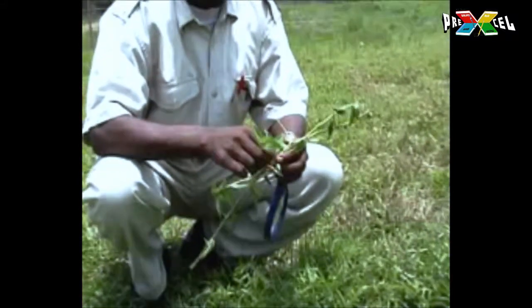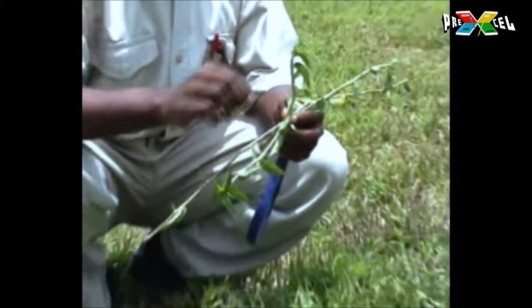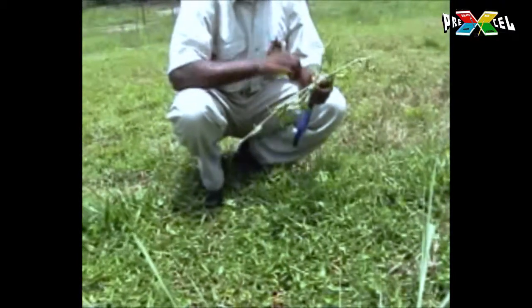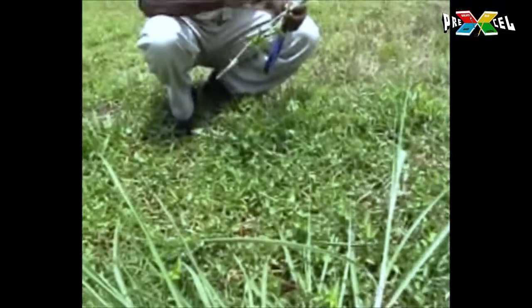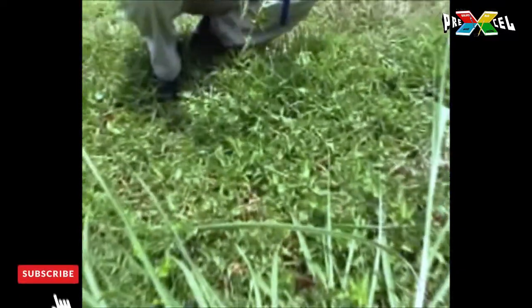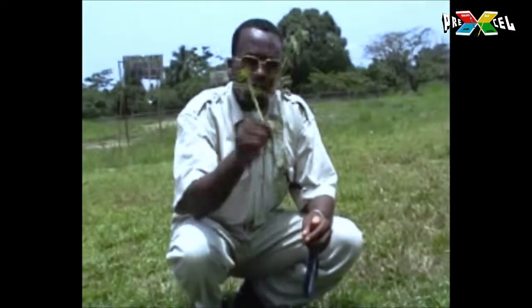This grass, we call it the Commelina, and this grass is very important for biology practicals. We either use this grass or we use what we call the Tradescantia, which is similar to this. If candidates know that this grass that is just growing around the school is what is used to give them certificates, then they will be very observant of their environment. This grass that I've just cut here, we have preserved it, it is in certain locations, and we always use it for microscopy. When we take this grass to the lab, we use it to answer a full question, and this question can award candidates about 30 marks.